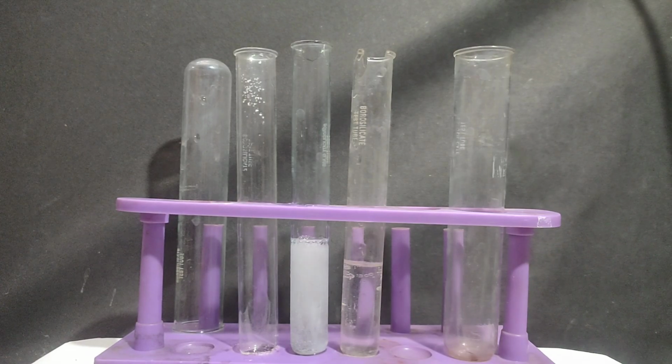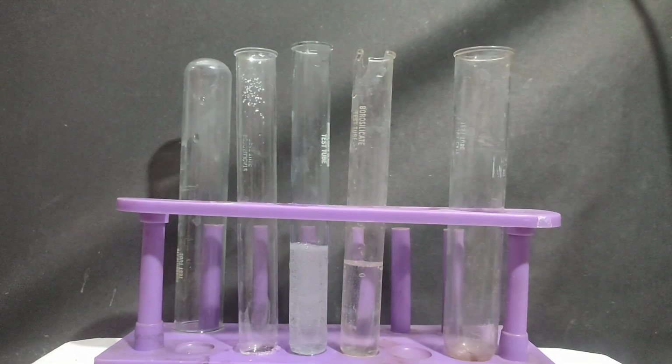So with the magnesium sulfate we can differentiate bicarbonate from carbonate, and by the use of hydrochloric acid we can know the evolution of carbon dioxide gas. And if we pass that gas into lime water, the lime water will turn milky. The gas is odorless and colorless. So by all these tests we can confirm that the salt contains carbonate as an acidic radical, and later on we can differentiate carbonate and bicarbonate.